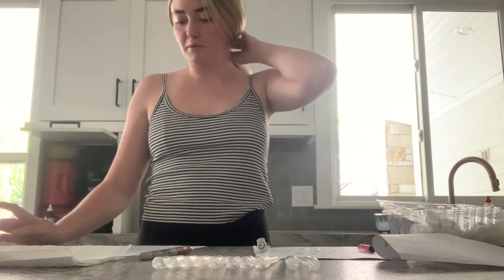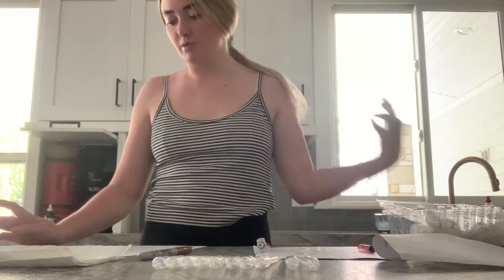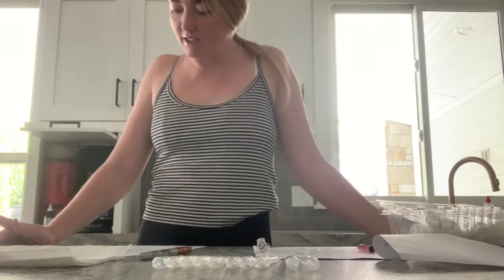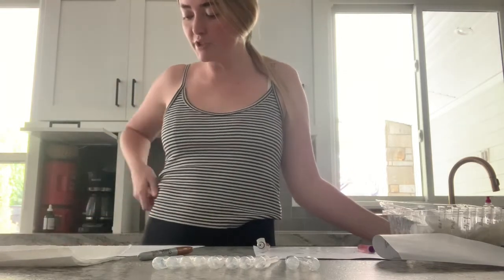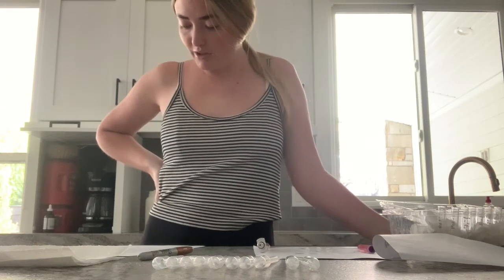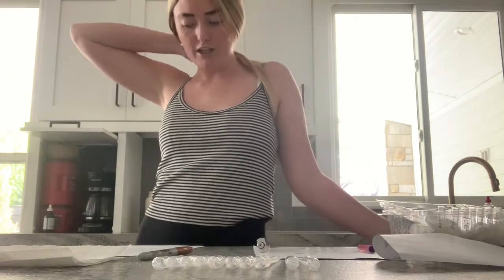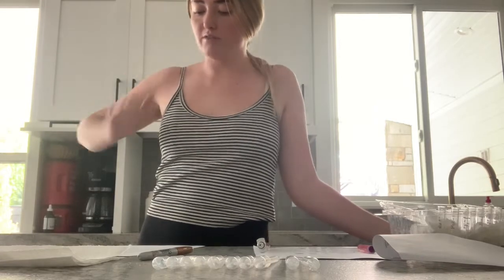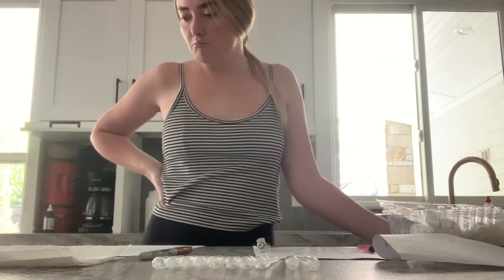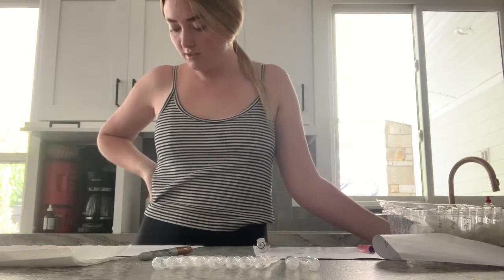And this will be done by performing a serial dilution of the sample with deionized water, checking acetone levels with ketone tablets, and observing the color change that will occur. The K-check or ketone tablets will change in color, which will indicate the concentration of acetone in the urine sample. The darker the color, the higher the concentration.